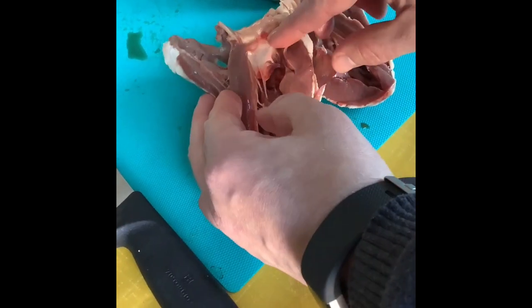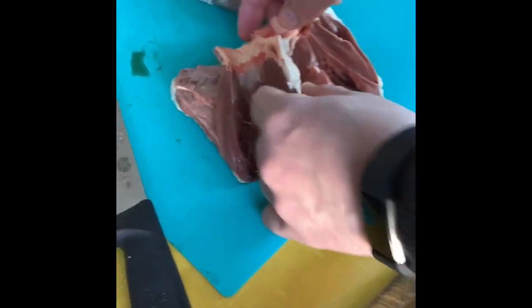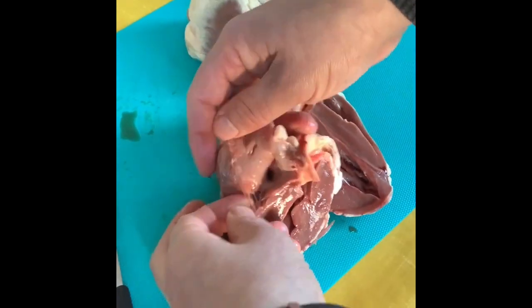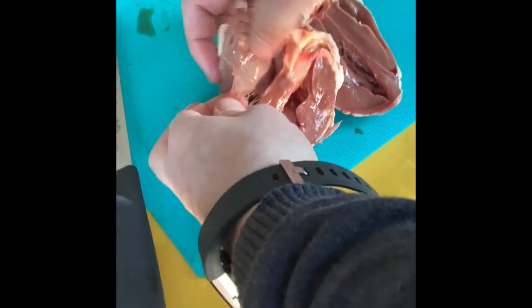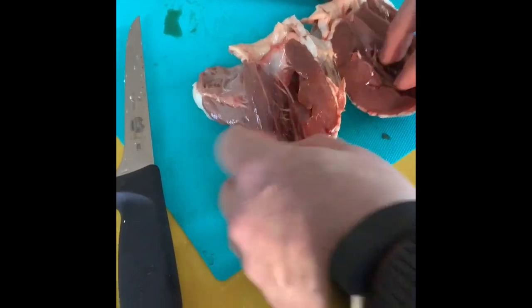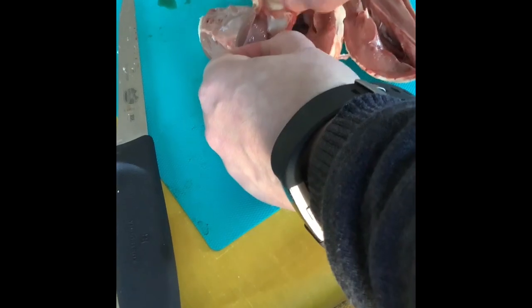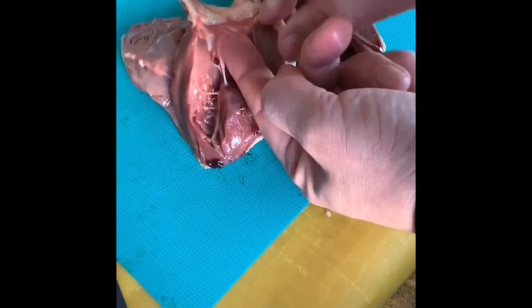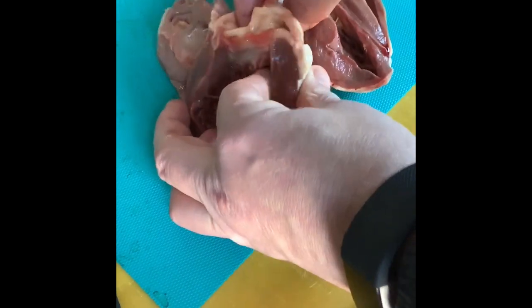Here we can see the left-hand side of the heart and the right. We can see the atria, and these heartstrings — if I pull them out you can see there's a flap there, which is a valve. That's on the right-hand side: the remnants of the tricuspid valve. On the left-hand side we can see a lovely big valve — that is the bicuspid valve. The heartstrings don't pull the valve; they just stop it from inverting and going in the wrong direction.